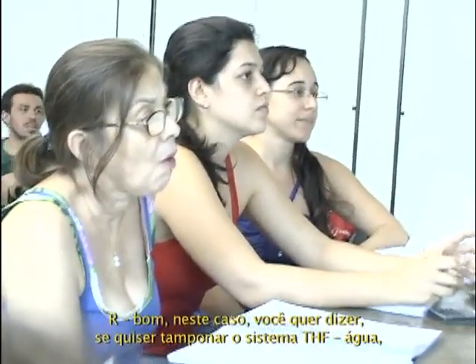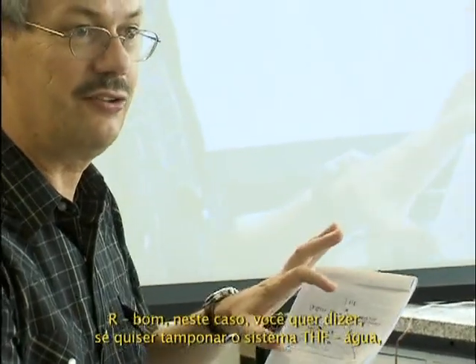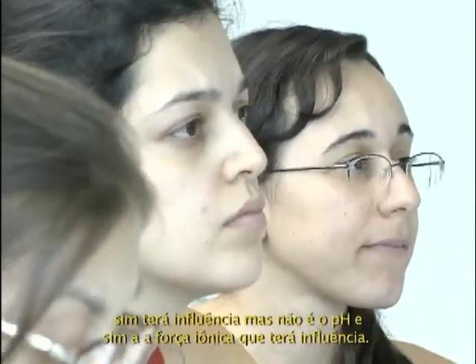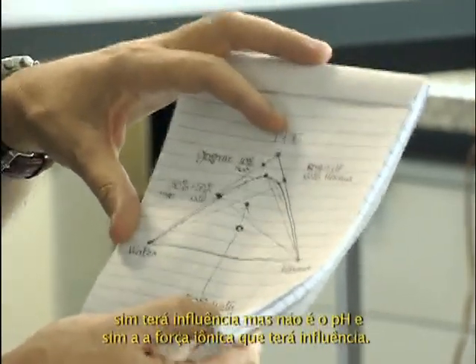The pH? In that case, you mean if you want to buffer the THF-water system, yes, it will have an influence, but it's not the pH. It's the ionic strength that will have an influence.